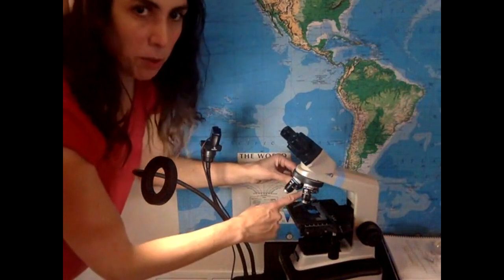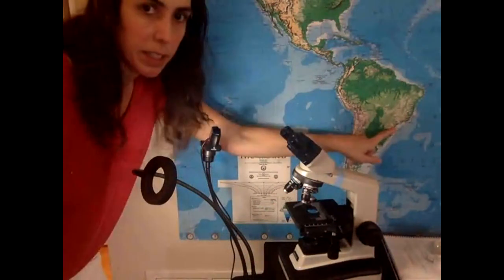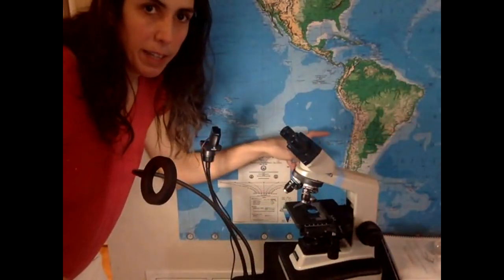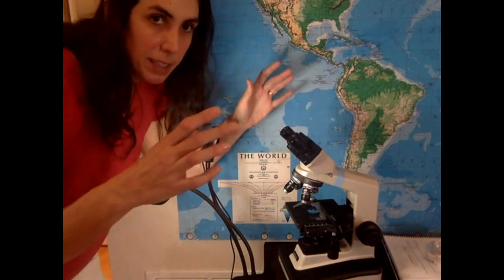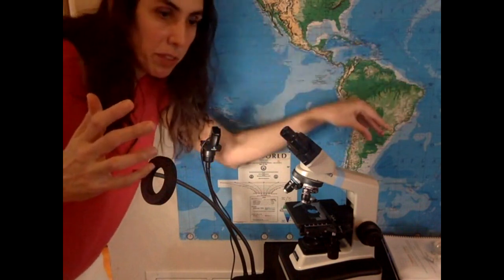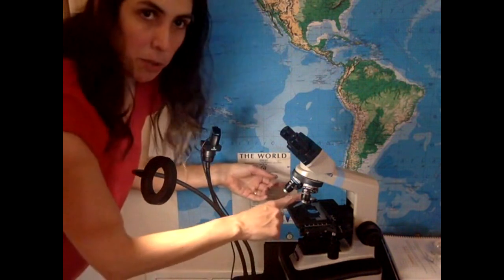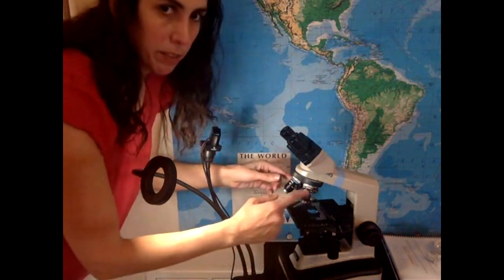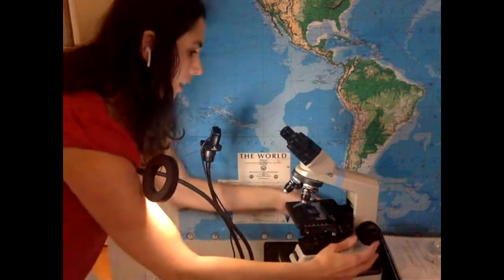Then I move to my lowest magnification. So just think you're looking at, maybe looking at my city, which is like over here. But if I showed you, okay, find this city in Brazil, but I showed you my state, you would have no idea. So you have to move out first and go, oh, I see the whole country, and then you move in. That's the same thing with the microscope. So we use the lowest magnification objective. The objectives are the lenses that are close to the object.